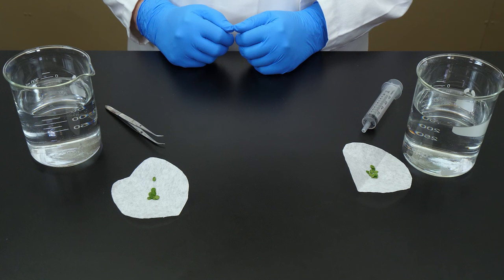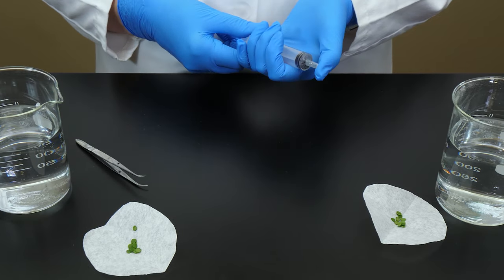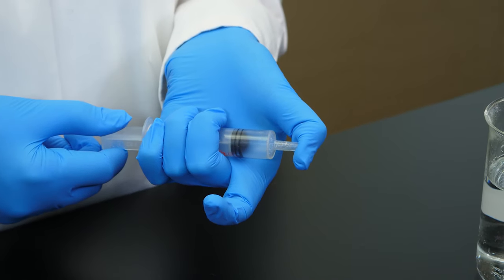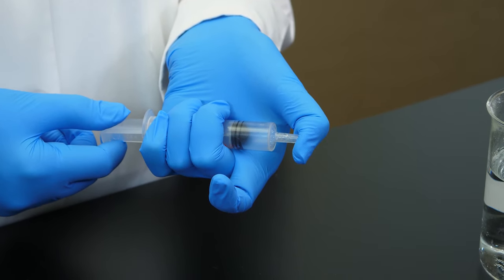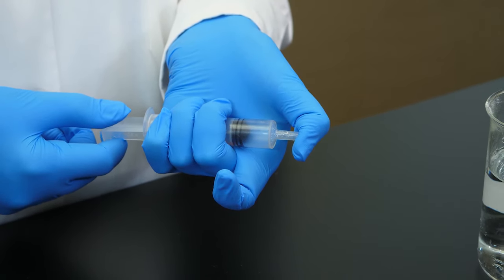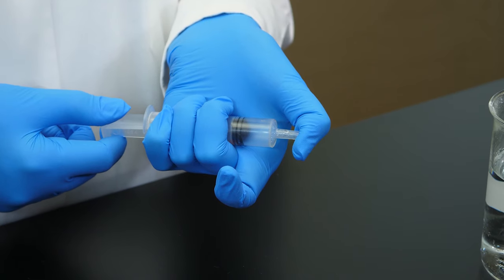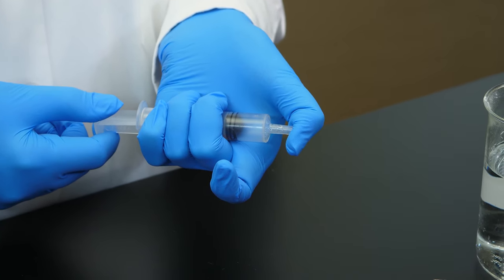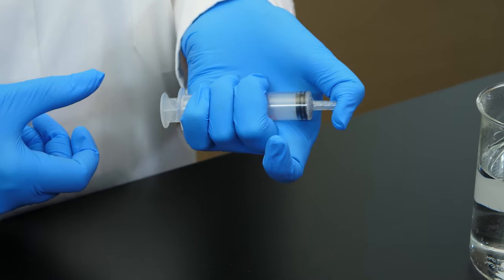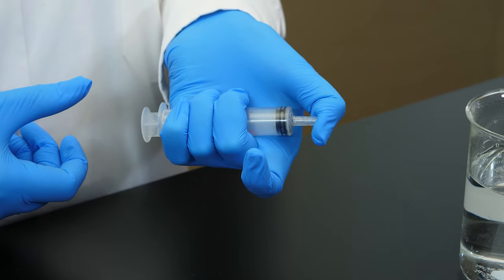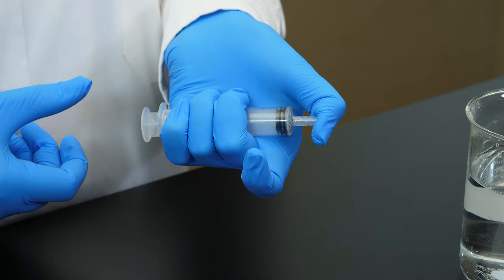We need to force the air out of the chads using a syringe. If we hold the tip of the syringe closed and pull out slightly on the plunger, we create a partial vacuum inside the syringe. With a partial vacuum inside the syringe, the air pressure inside the barrel is much less than the pressure outside the barrel. When we release the plunger, the outside pressure forces the plunger back to its former position.